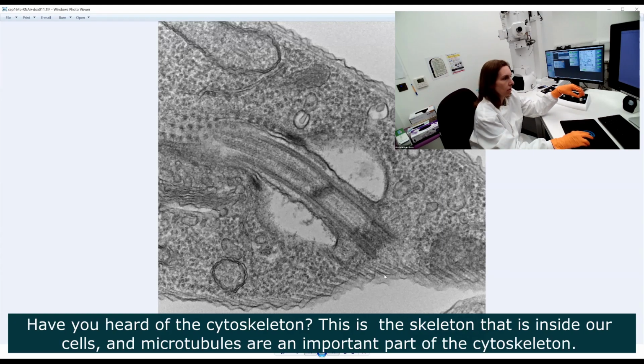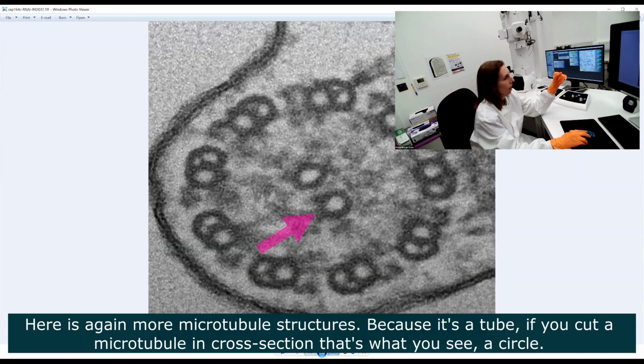So it has all these microtubules here. Have you heard of the cytoskeleton? It's the skeleton that's inside our cells, and microtubules are an important part of the cytoskeleton. And here are the microtubules down here. There's more microtubules in here. Here is again more microtubule structure. Because it's a tube, if you cut the tube in cross section, you see a circle.